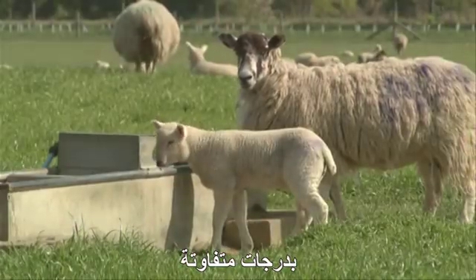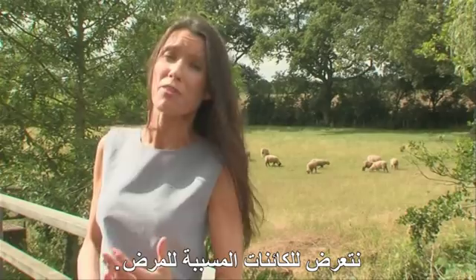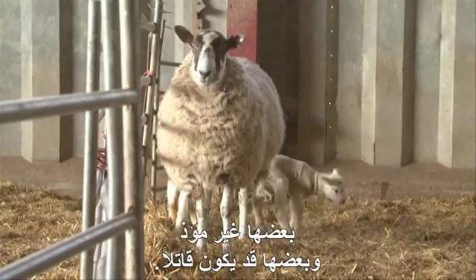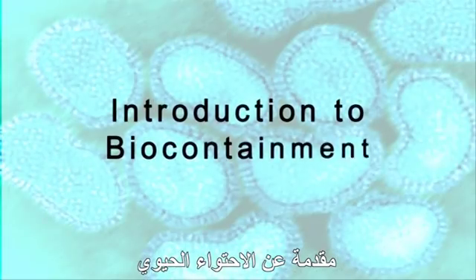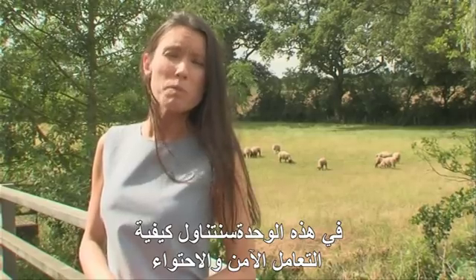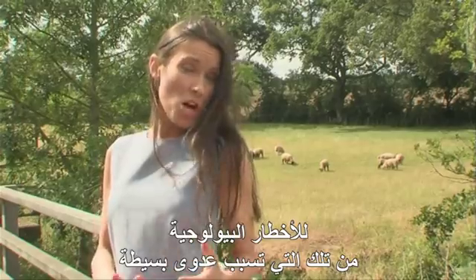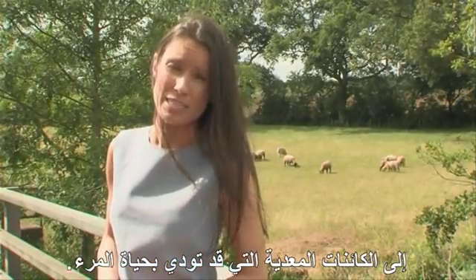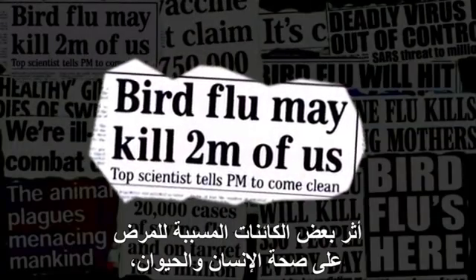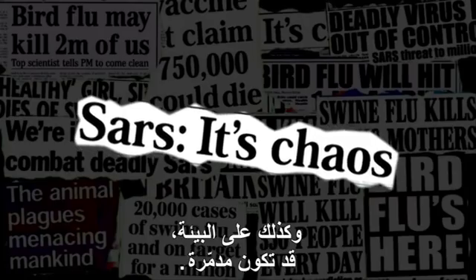To a greater or lesser extent, we, along with all other living creatures, are exposed to pathogenic organisms. Some are relatively harmless, but others can be fatal. In this module, we'll be looking at the safe handling and containment of biohazards, from those causing mild infections to potentially deadly infectious organisms.